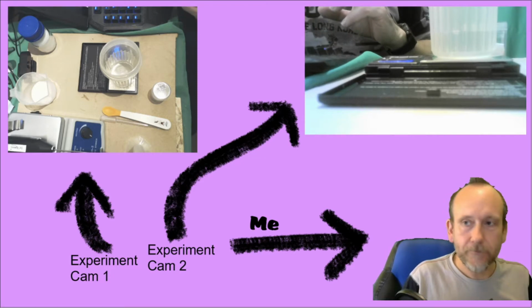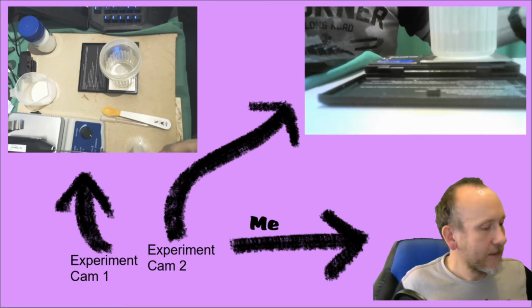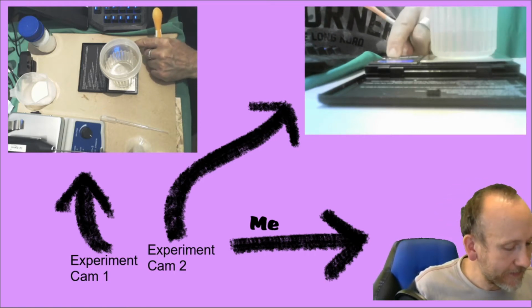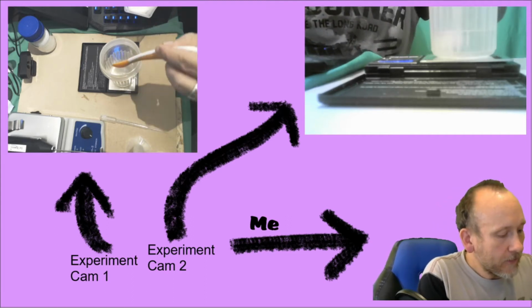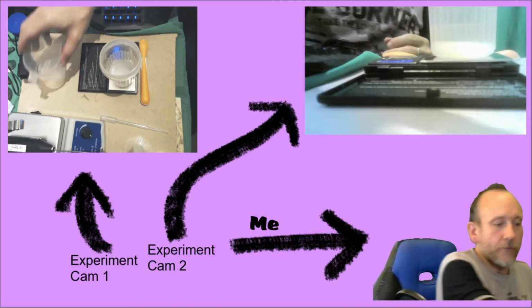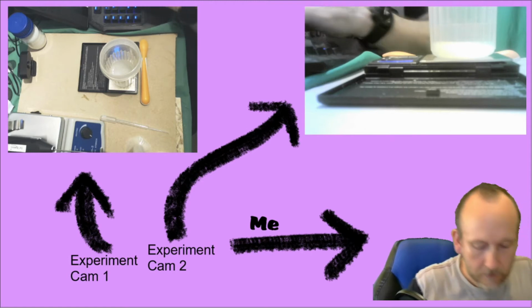Okay, so then I'm going to add my citric acid, and the idea with the citric acid is that it's there in excess, and I will add approximately accurately 25 grams of citric acid. 25.14. Okay, so 25.14 is approximately accurately measured citric acid.